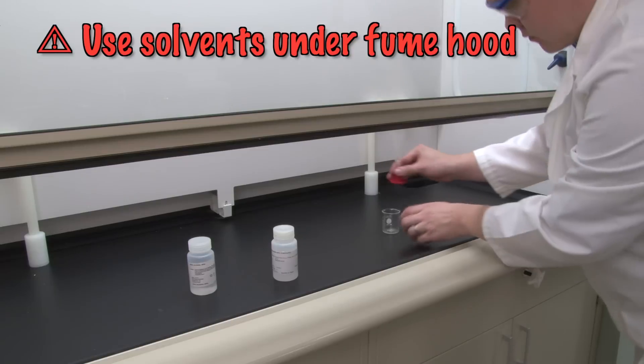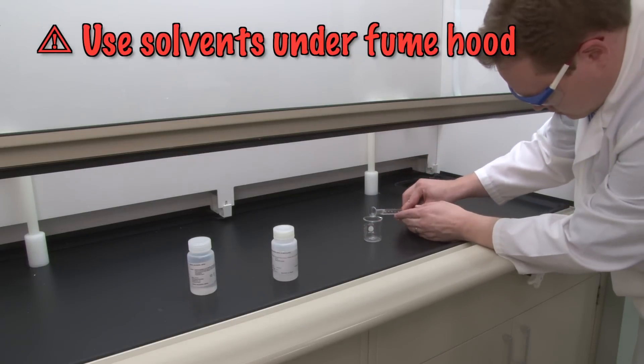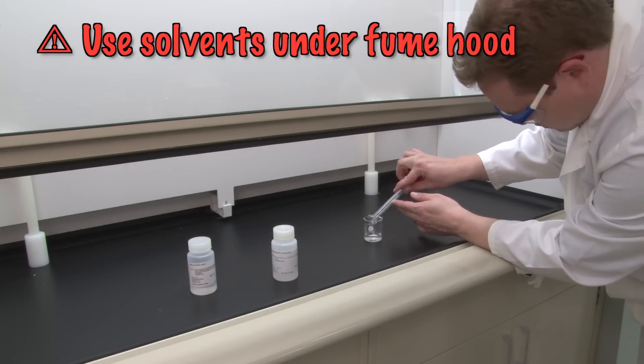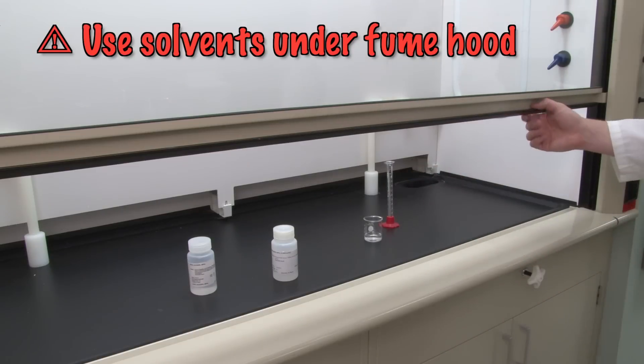We also need to make sure that no solvent vapors get into our breathing air, so the solvents will only be used under the fume hoods. Make sure the hood sash is pushed back down whenever possible.